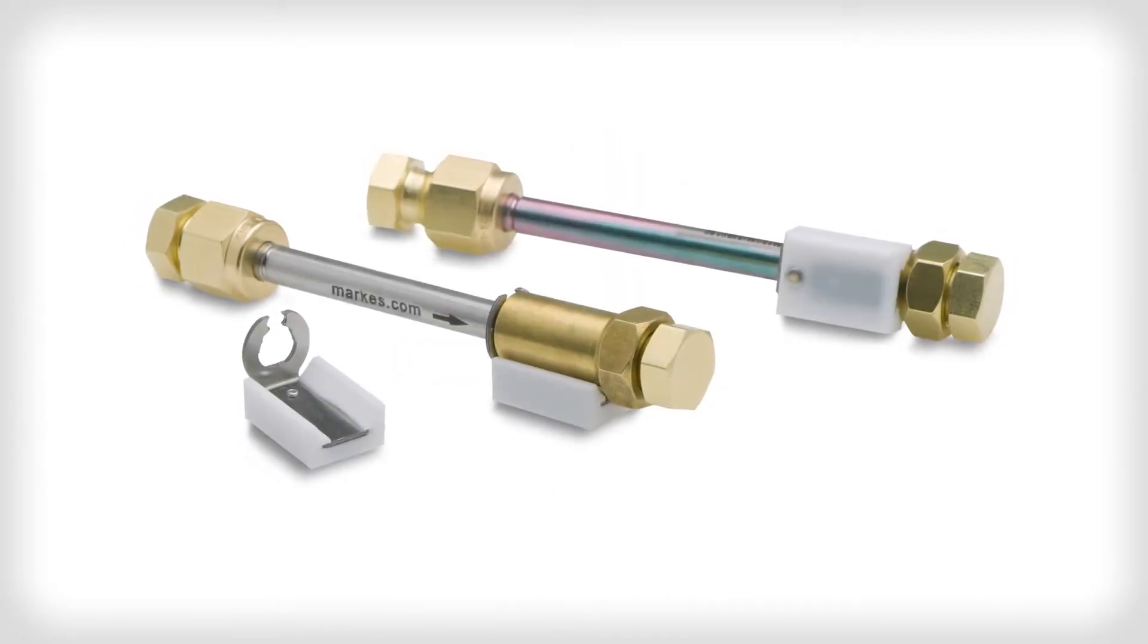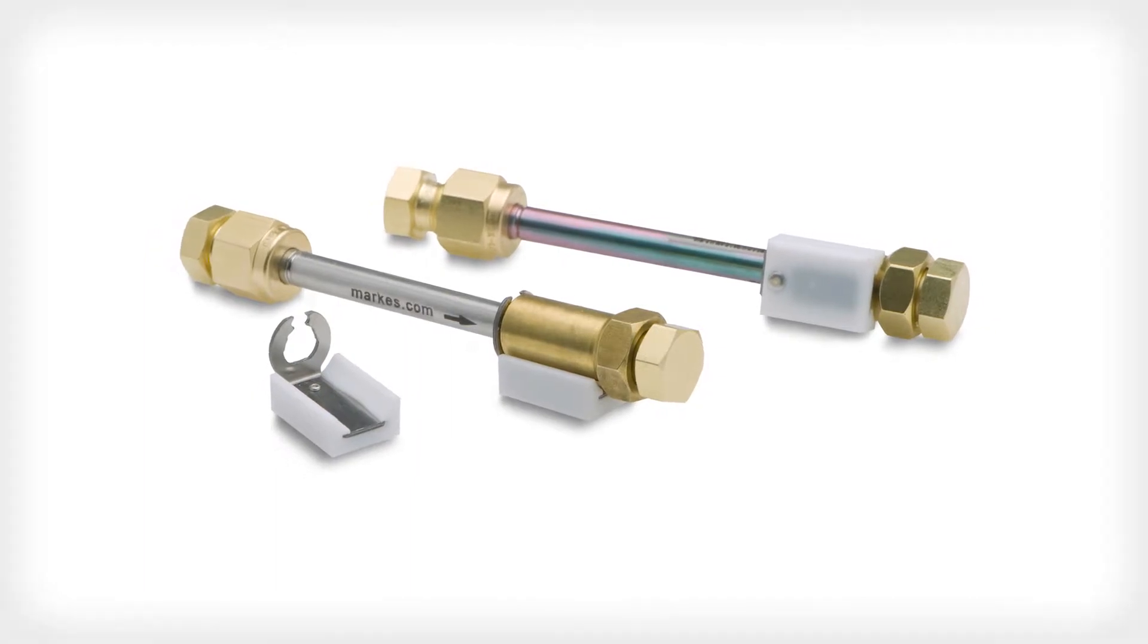The process is different for metal tubes and glass tubes. In this video you will see tagging of stainless steel sorbent tubes.